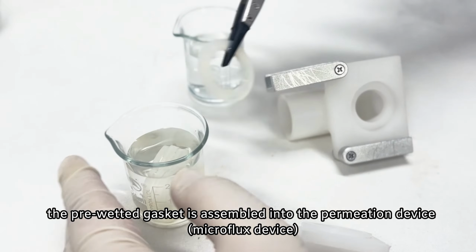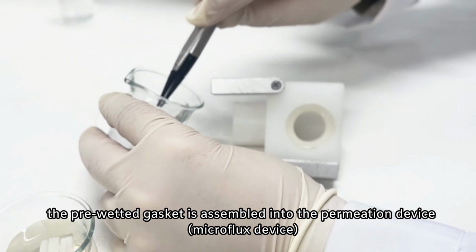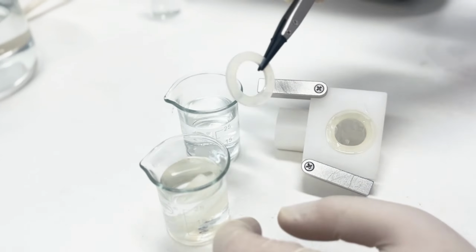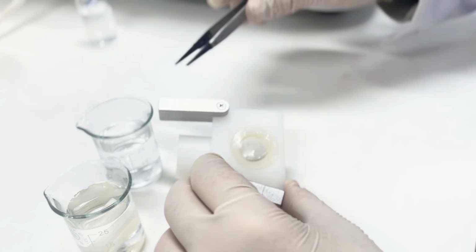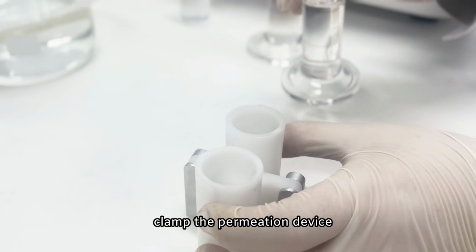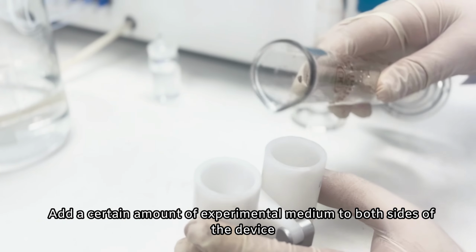At this point, the pre-wetted gasket is assembled into the permeation device, the MicroFlux device. A permeable membrane is placed between the two gaskets. After assembling the gasket and the permeation membrane, clamp the permeation device. Add a certain amount of experimental medium to both sides of the device.